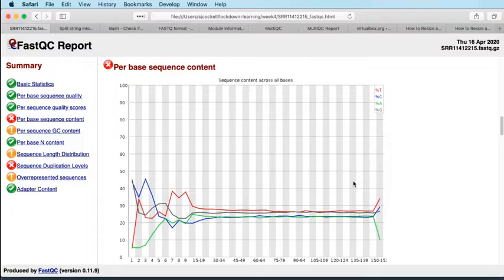What you will find if you analyse a lot of sequencing data, and I have analysed a lot of sequencing data over the years, is that actually this plot is very rarely parallel. And there are lots of reasons for that. So the assumption of parallel lines comes from if you were doing an unbiased genome sequencing experiment. So you would expect that your fragments are randomly generated from your genome, that there's no bias in the way that they're distributed, and so the distribution of base content in your reads should be the same as the distribution of base content in your genome.